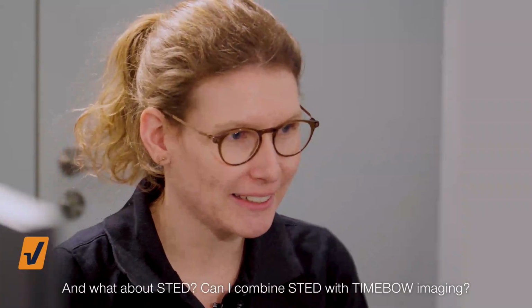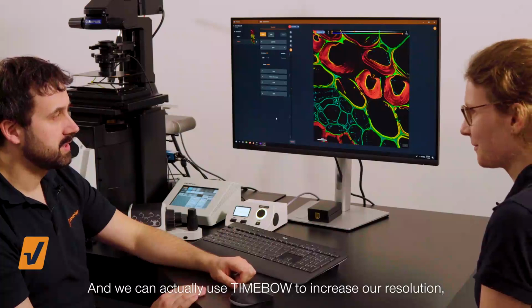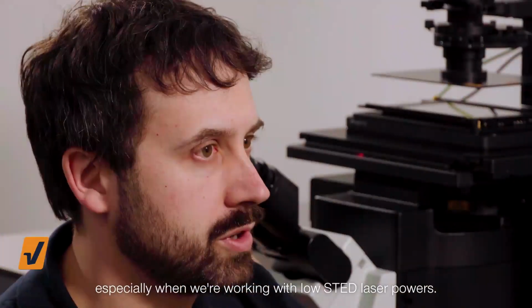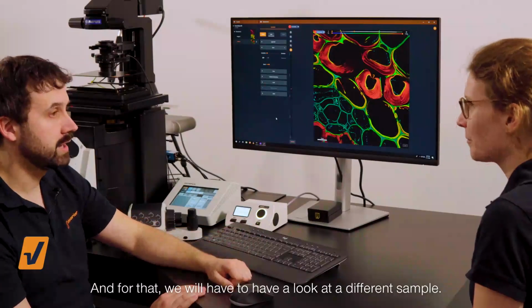And what about STED? Can I combine STED with TIMEBOW imaging? Yes, of course. And we can actually use TIMEBOW to increase our resolution, especially when we're working with low STED laser powers. And for that, we will have to have a look at a different sample.